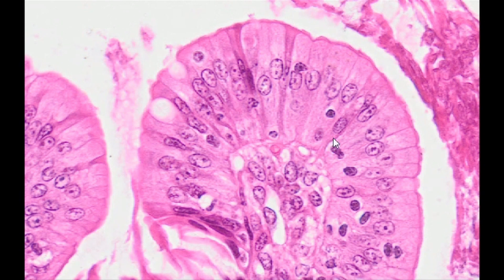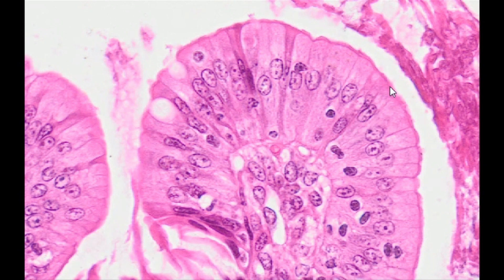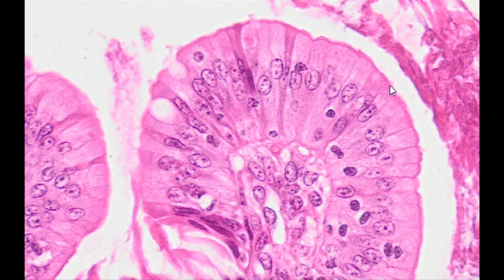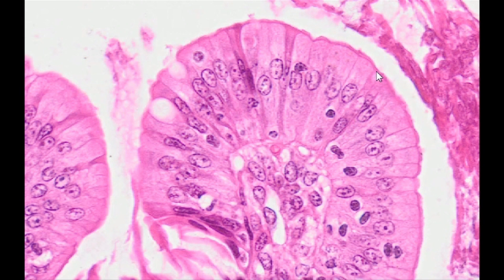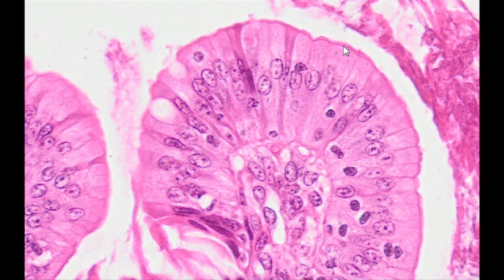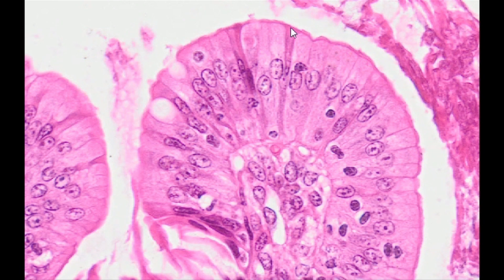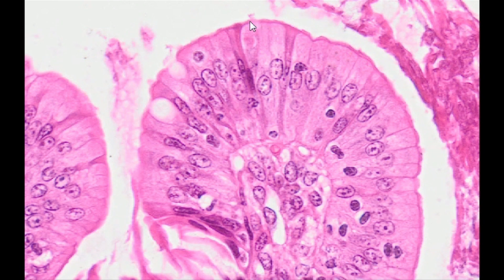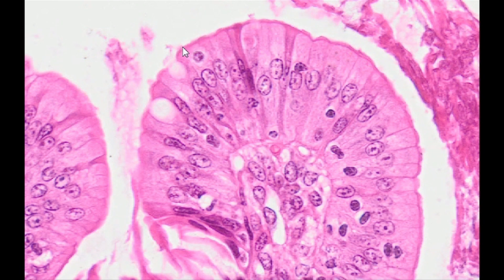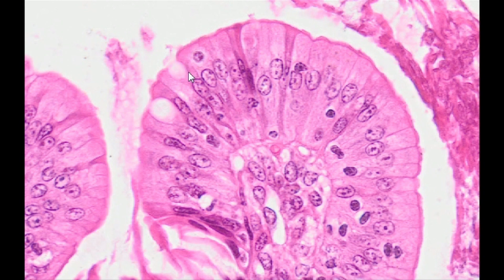1. Enterocytes — typical columnar cells with microvilli on the apical surface, which form the so-called brush border, visible in the specimen as a darker, thicker line on the epithelial surface.